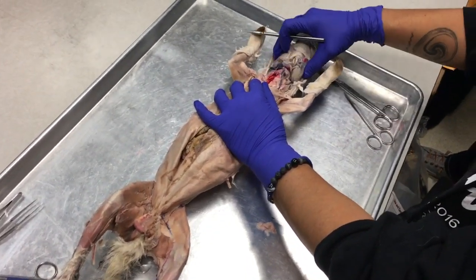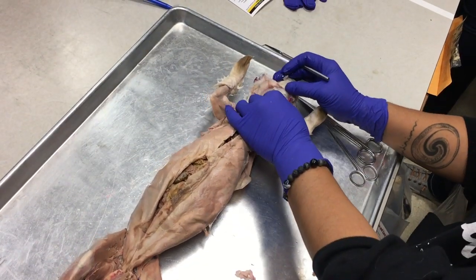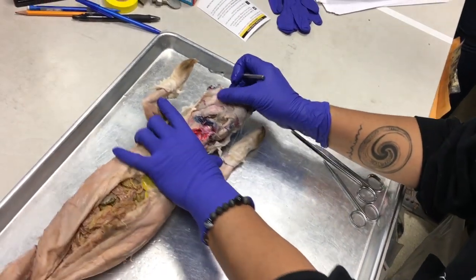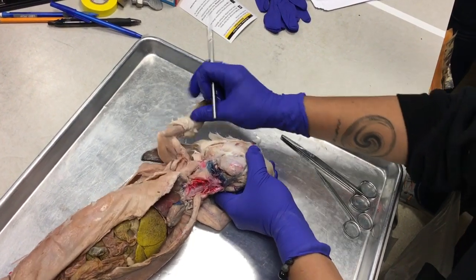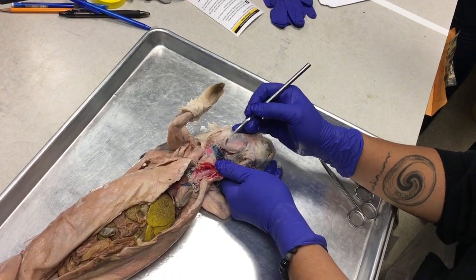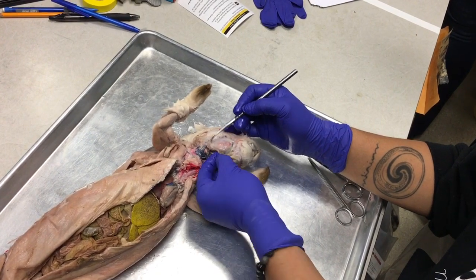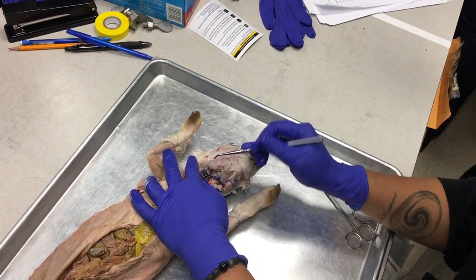All right, so starting up at the top of the rabbit's face, what I wanted to point out, first of all, is this huge cheek muscle. This cheek muscle is called the masseter muscle. When you're digging through your rabbit, I want you to peel the skin up toward the ear, and also dissect away some of the connective tissue surrounding the masseter muscle. What you're gonna find is this grayish, brownish, chunky stuff in the connective tissue up by the ear and around the masseter muscle.